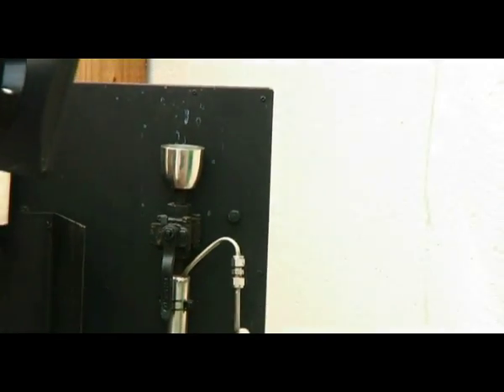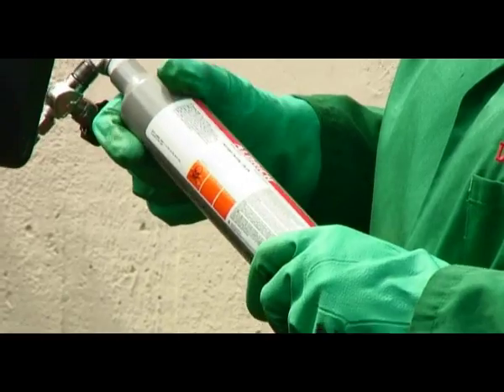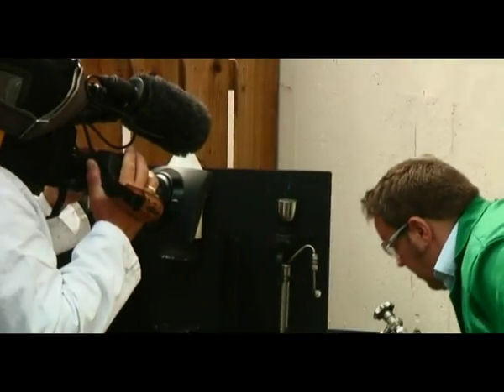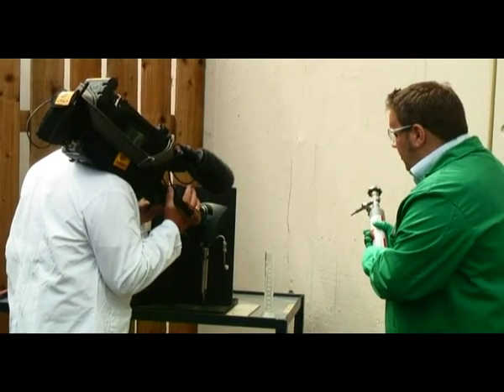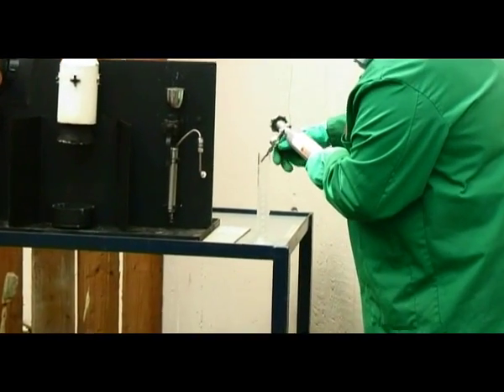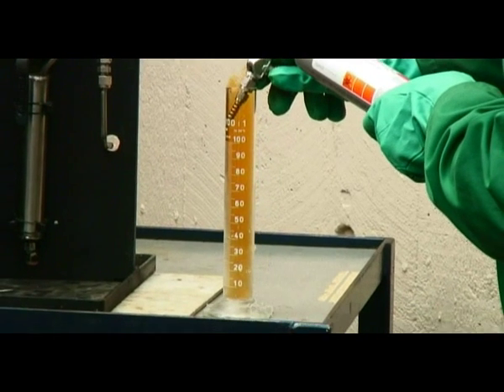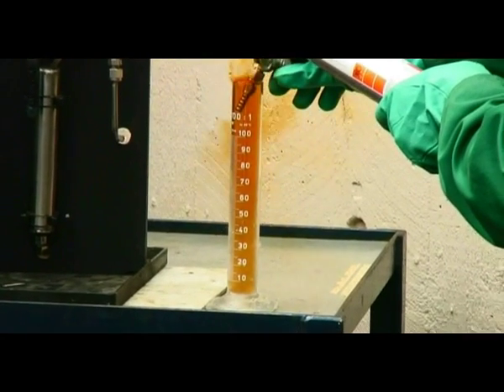The oxidant for this chemical reaction is N2O4. It is liquified inside this cylinder, but as you will see when I get it out of the cylinder it forms an orange liquid, and that orange liquid breaks apart into two molecules of NO2 which you will see as an orange gas above the liquid. Here we have a cooled measuring cylinder which we cooled in ice. Now I am going to condense the N2O4 into the measuring cylinder. We're going to try not to breathe this material because it can be quite toxic. And you can see the orange fumes.